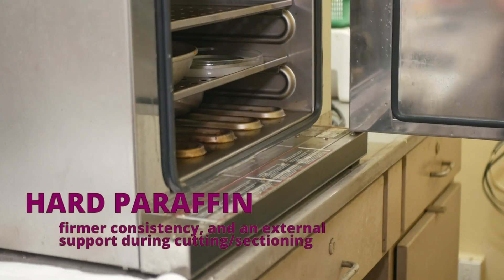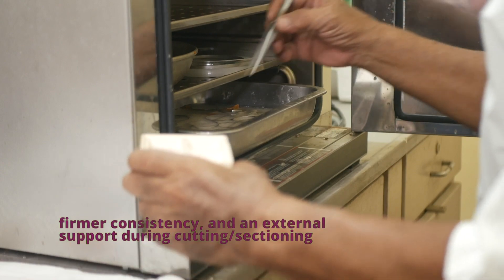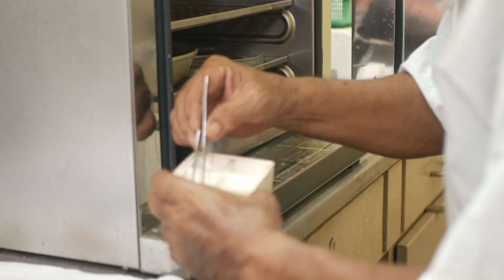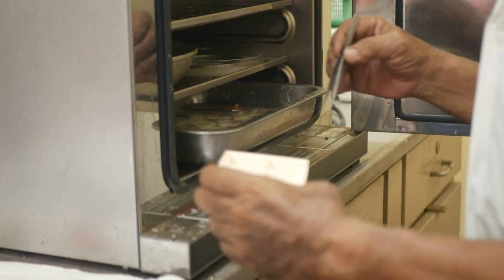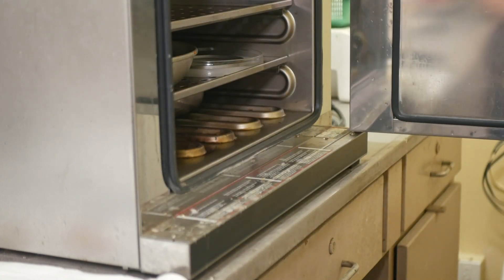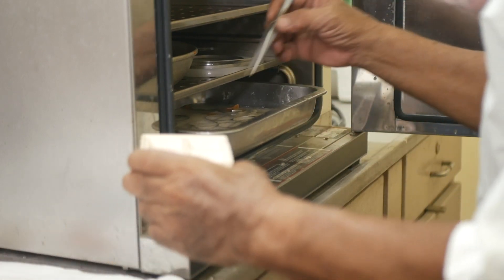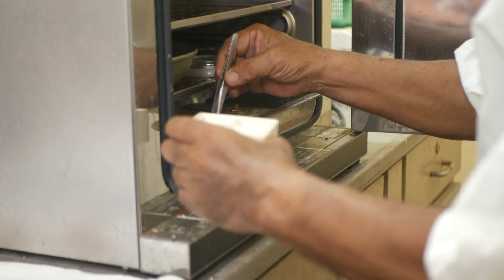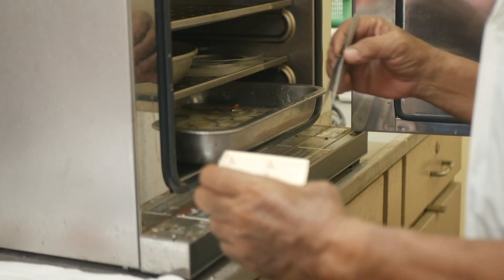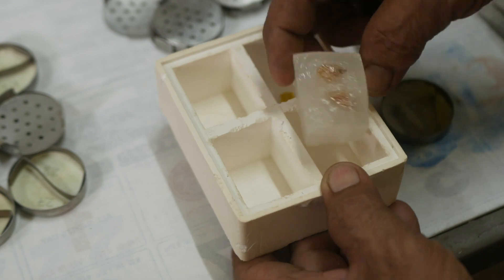Next is embedding in hard paraffin, wherein the tissues are placed in an arranged position in a mold. Hard paraffin provides firmer consistency and external support during cutting and sectioning. The embedding is then allowed to cool and solidify. It is also important to note the melting points of both the soft and hard paraffin, as this may affect the penetration and quality of the embedded tissue. Soft paraffin melts at 46 to 48 degrees Celsius, while hard paraffin starts to melt at 56 to 58 degrees.